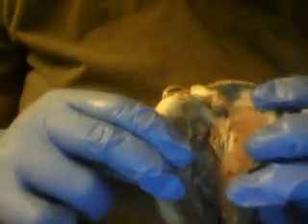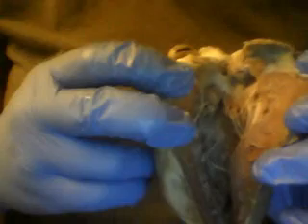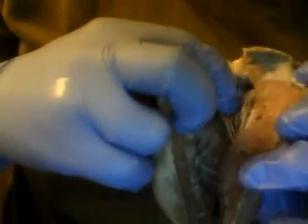They are the stringy things holding the valve to the heart. And the cusps of the valve are the big white parts of the valve themselves. And the papillary muscles are the muscles behind that holding the valve to the heart inside.